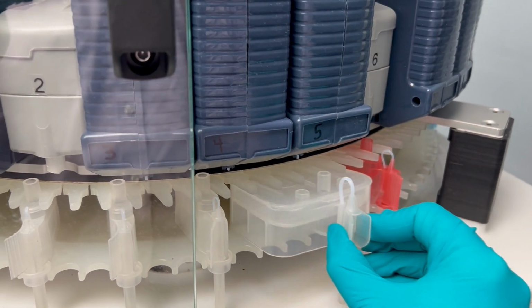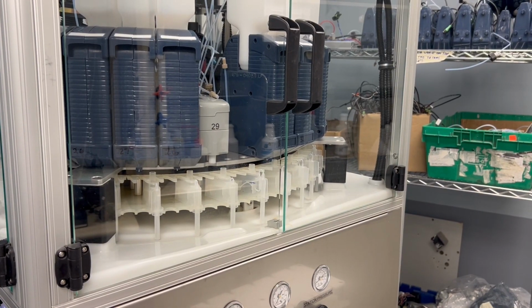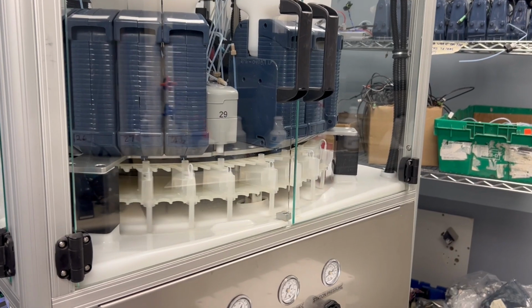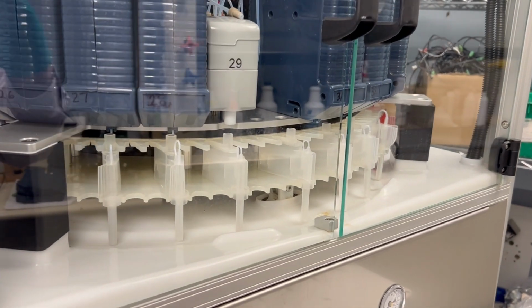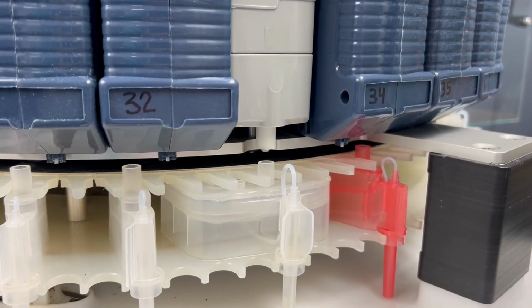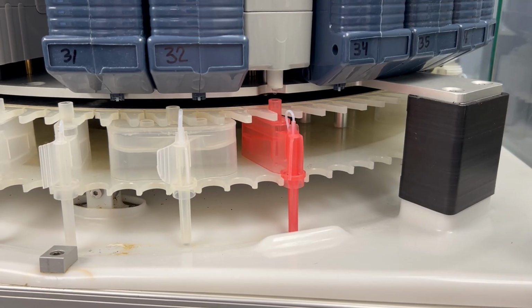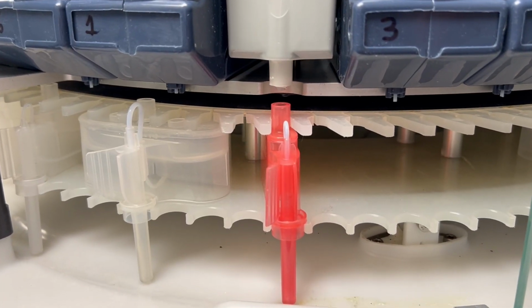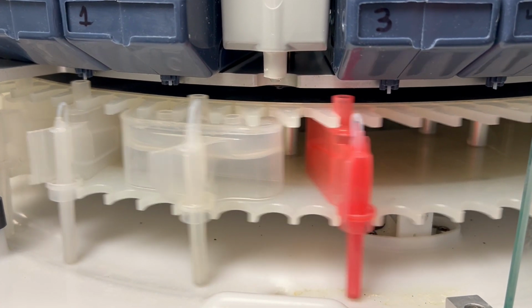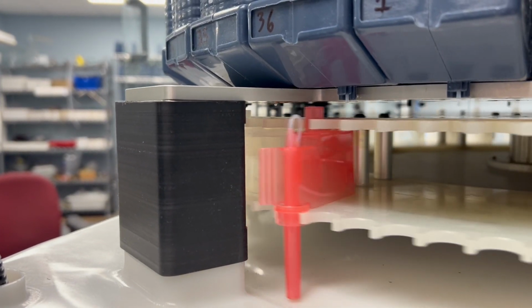Now, TETRAS takes the ball and does what it does best. The intuitive software optimizes carousel movement for maximum efficiency throughout the programmed synthesis. In this quick montage, you'll see each component working seamlessly in tandem. Every station and vessel can run its own unique protocol, giving you unlimited versatility. Up to 108 separate peptides synthesized asynchronously. And the best part? There's no need to wait for a previous run to finish before starting the next.